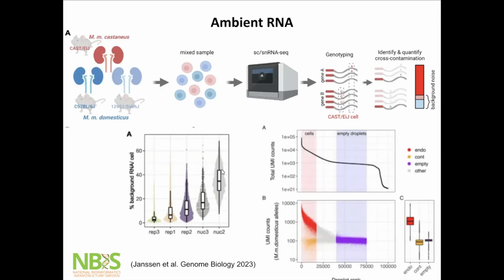One super nice paper that is looking at this with ambient RNA is this paper where they mixed 3 different mouse strains and then pooled them together, did the sequencing. Then for each cell, they look at the different SNPs that are known for the different strains, and they define each cell as belonging to either of the 3 strains, depending on the majority of the SNPs, and then they estimate the background based on all other SNPs that are from the other 2 strains. So basically, you would see that these clear cells that have a lot of counts from one of the strains, they still have a few reads here. That's the background from the other strains. But then as you go lower and lower in the numbers here, the proportion of this background contamination is higher.